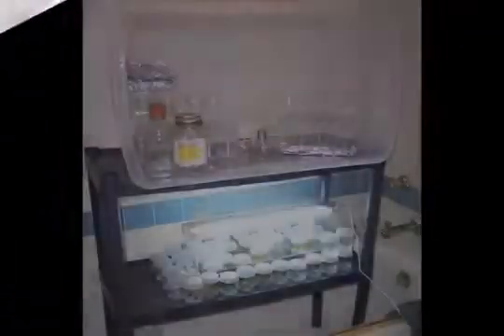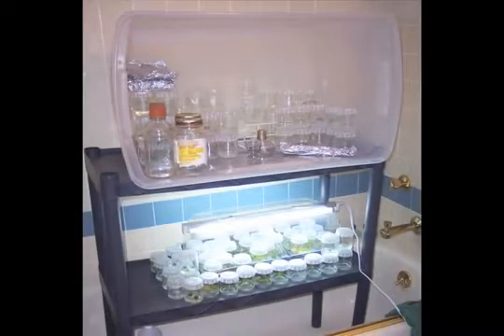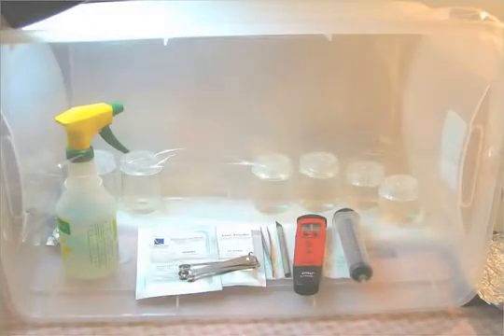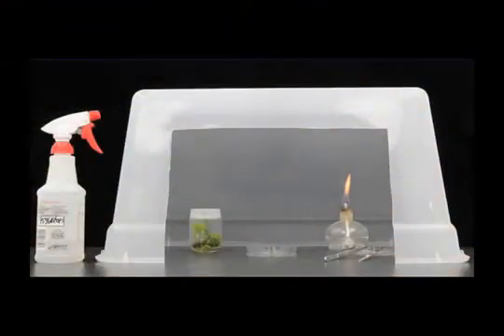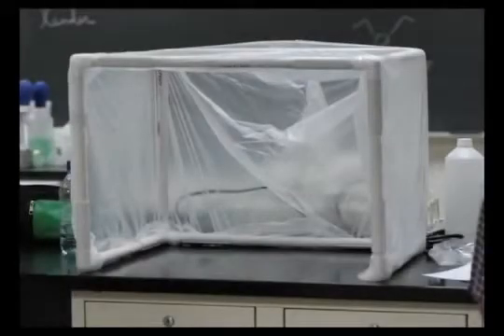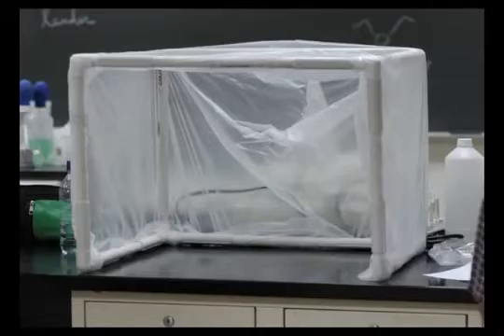If you cannot afford a laminar flow hood, a transfer cabinet can easily be built providing an enclosed environment that is not sterile but can be sterilized. A cardboard box lined with aluminum foil or plastic, or a well-cleaned aquarium, provides a shield to reduce contamination. A box that is 20 to 24 inches wide, 20 to 24 inches high, and 12 to 16 inches deep provides a good work area. Working inside any of these does not guarantee success.